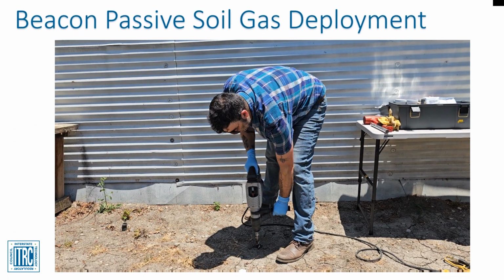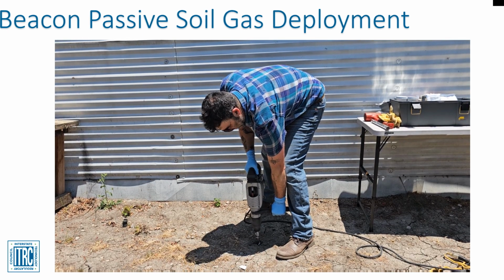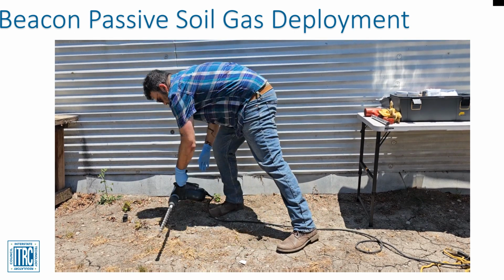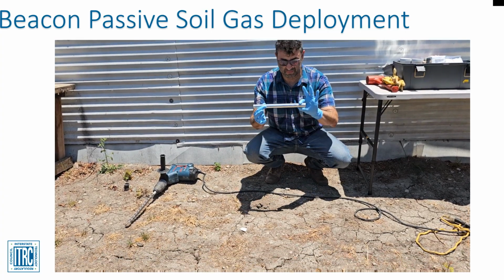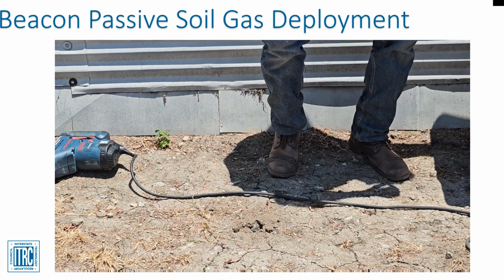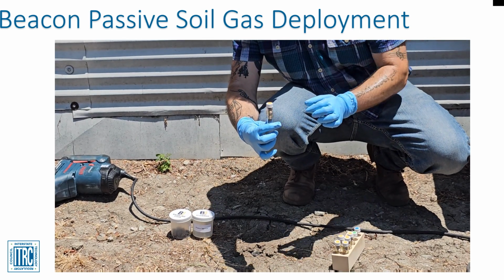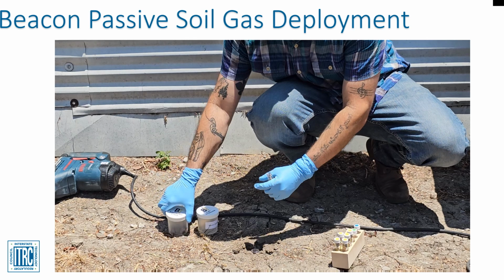To deploy the Beacon PSG sampler, follow these steps. Before going out to install, the field personnel should verify the sampling kit provided includes all the necessary supplies. The field personnel should also make sure they have all the necessary drilling equipment and PPE. The field personnel must first drill a vertical boring using their preferred drilling method. Typically, the boring is 1.5 inches in diameter to a depth of 12 to 14 inches, then continue with a half-inch diameter down to the terminal depth of 36 inches.